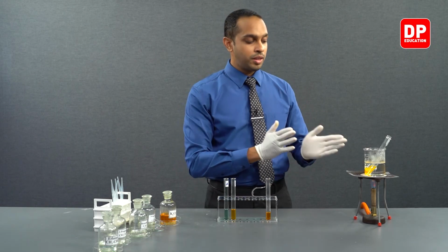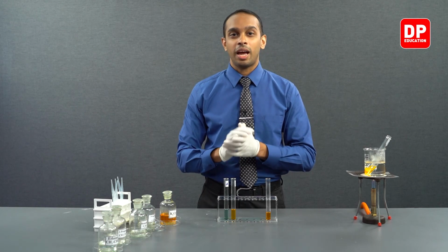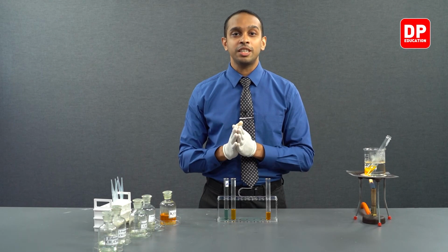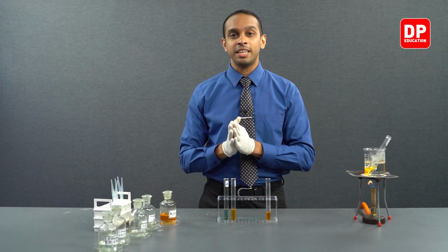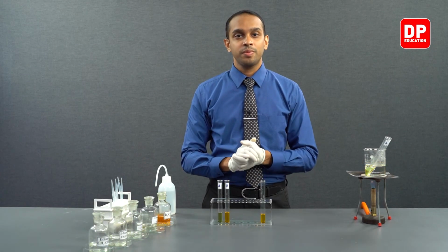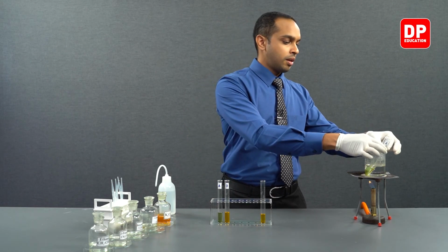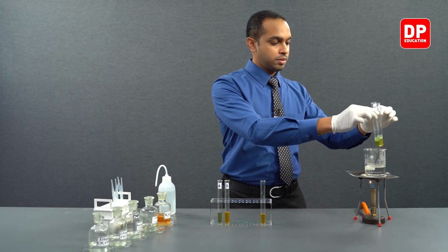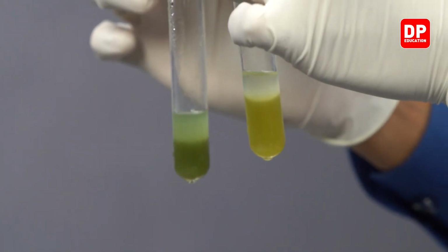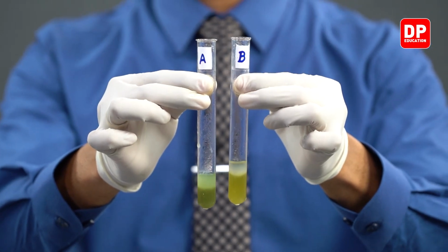When we provide these two mixtures some heat, the reaction will happen faster, and then if there is going to be a color change, we will be able to observe it faster. Let's see after a while whether the color has changed. Students, we have allowed the two test tubes to be heated in the water bath for a while now. Let's take them out. You can see here the two test tubes now have changed in color. Let's compare one by one.